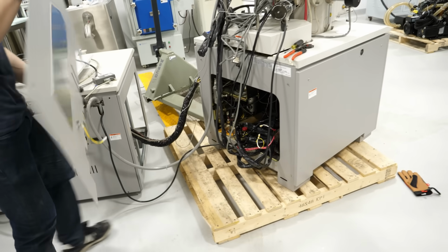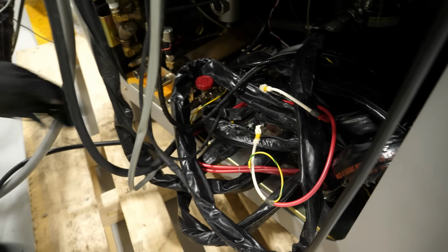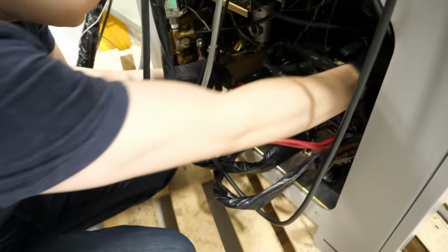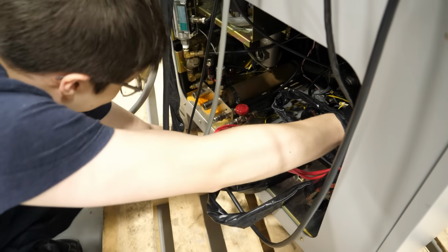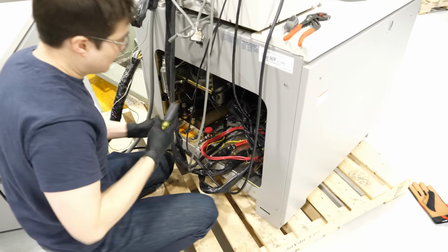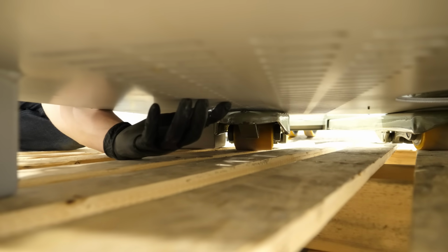Looks good. Zero access to the screws. No, it's down here somewhere. A lot of these are just wires that need to come out. So the screw is hidden behind a panel. Oh, it's right here. I'm assuming it's a Phillips, which is why I brought this. I'm undoing it, it's working. It's gone away.